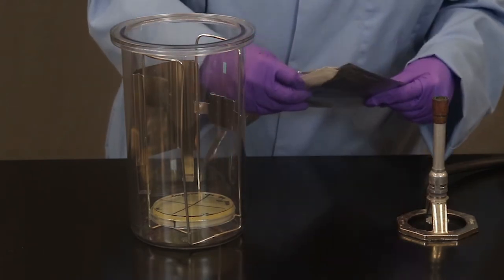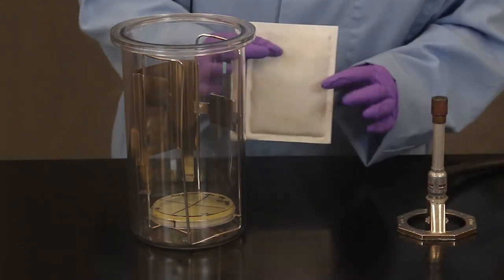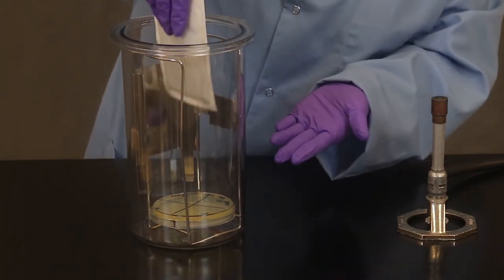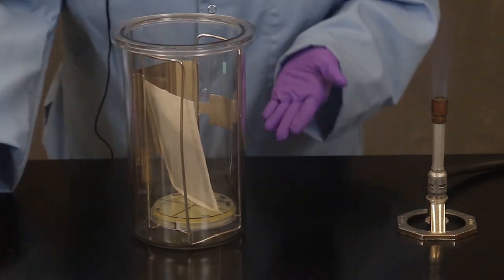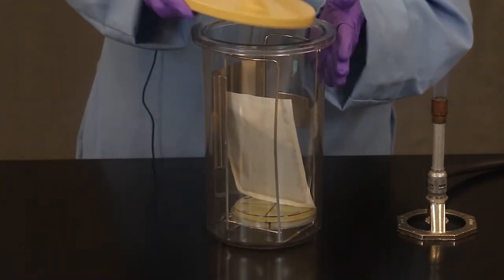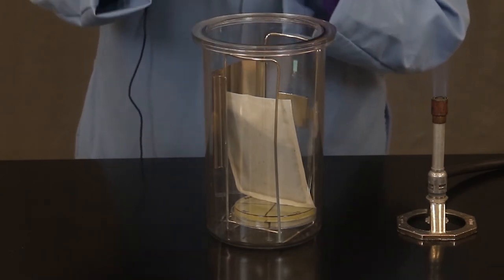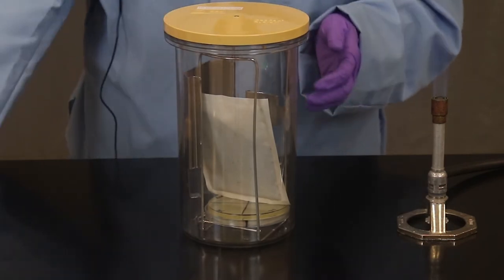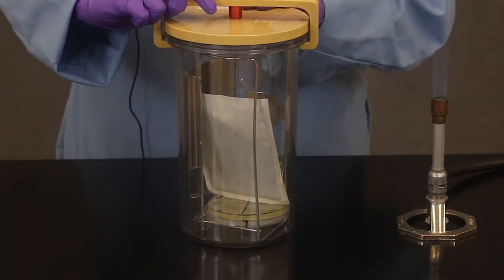So we tear it open. It's a sachet. You're going to learn about the properties in the lab manual. We don't have a lot of plates here so I'm just going to kind of stick it in. It doesn't really matter exactly where you position it but you do have to fit it into the jar. This has a rubber seal here. So we're going to line up the lid with the jar. And then we're going to screw it into position.